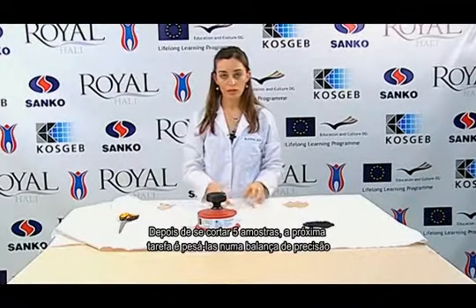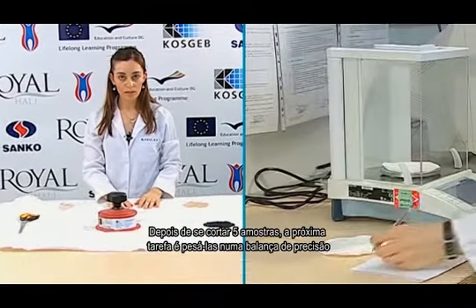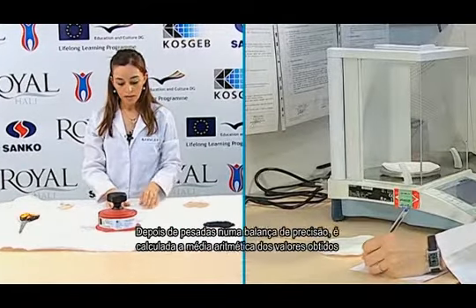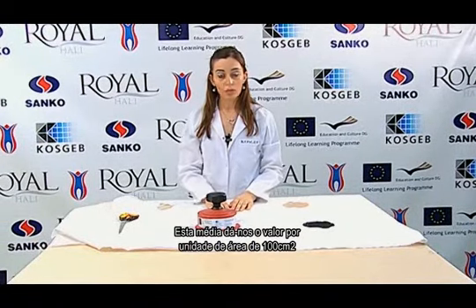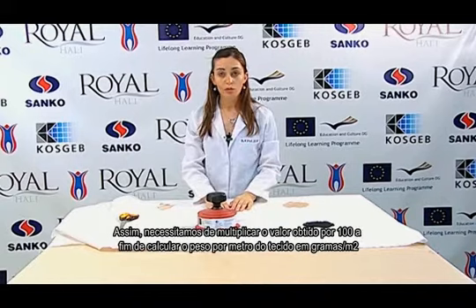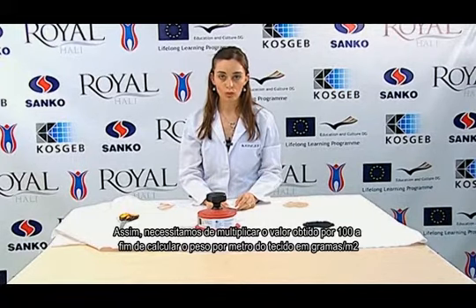After 5 test samples have been cut, the next task is to weigh them on the precision balance. After they have been weighed, the arithmetic mean of the obtained values is taken. This mean gives us the value per unit of the 100 square centimeter area. Thus, we need to multiply the obtained value by 100 in order to calculate the weight of the fabric in terms of grams per square meter.